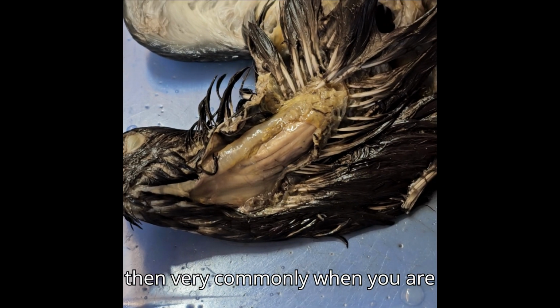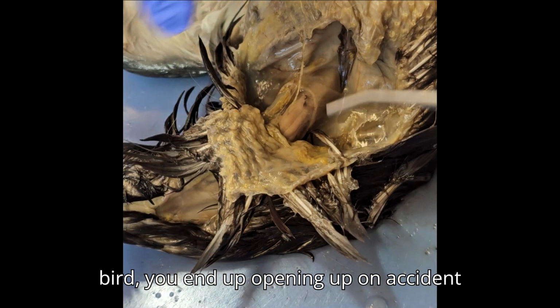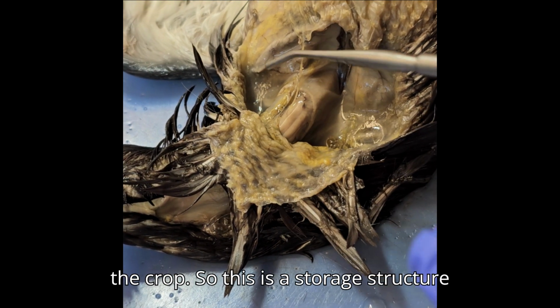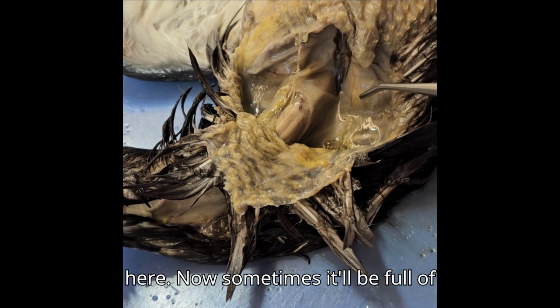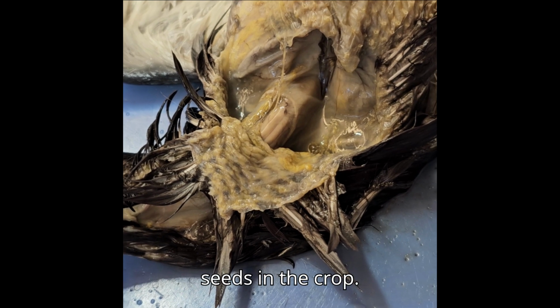And very commonly when you are defeathering the ventral surface of the bird, you end up opening up the crop by accident. So this is a storage structure here. Sometimes it'll be full of seeds. My particular pigeon had zero seeds in the crop.